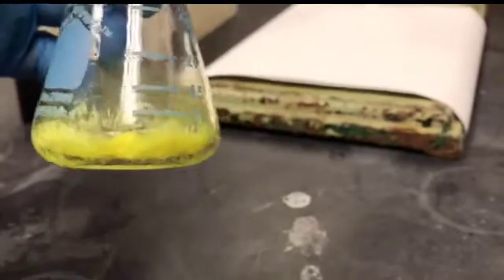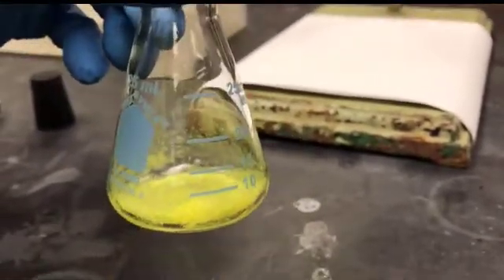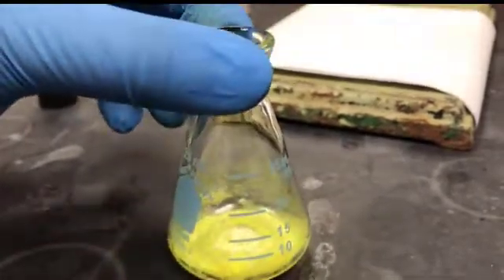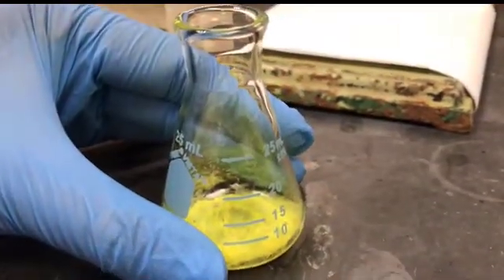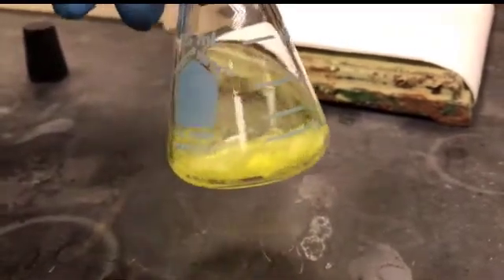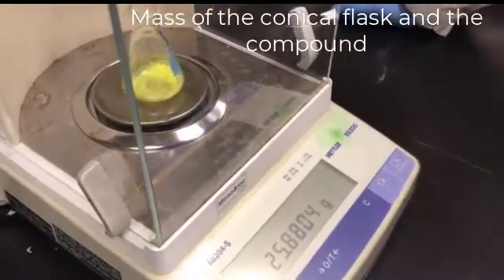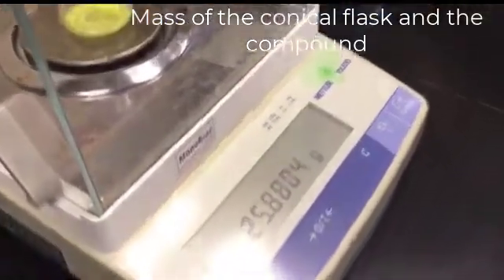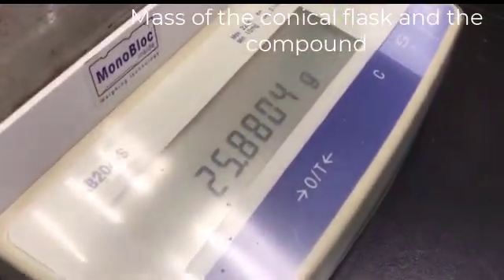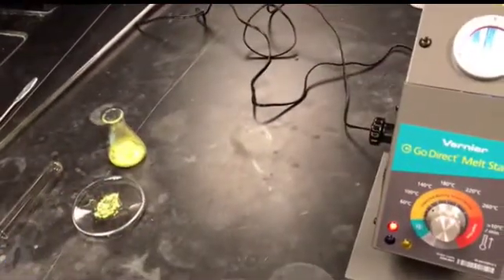I've dried the flask from outside, so no water droplets are outside. Now I let it sit for a couple of minutes so that it comes to room temperature. It's a little warm right now. When it comes to room temperature, I will check the mass and record the melting point. So this is the mass of the conical flask and the compound. You need to subtract the mass of the empty flask from this mass in order to get the mass of the compound.